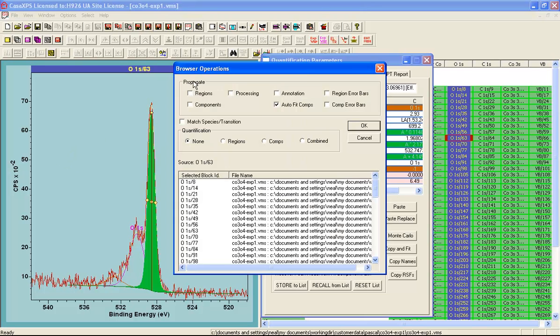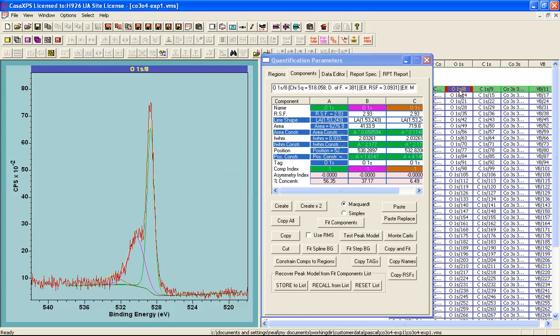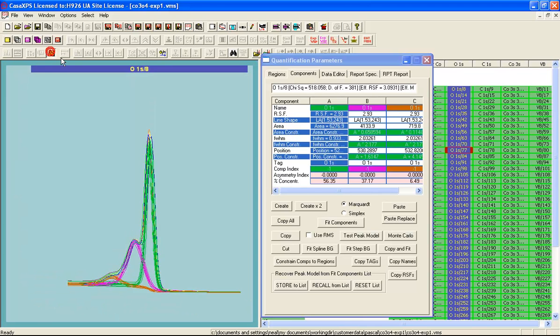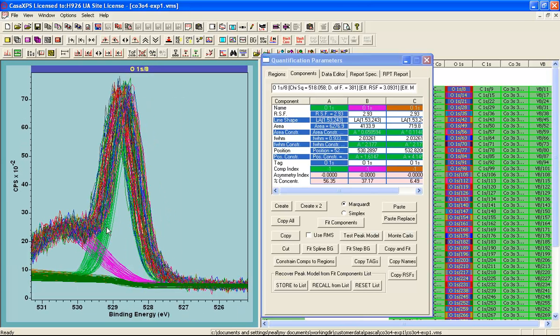So if I propagate, and then examine some of these other spectra once fitted. Indeed, what I'll do is overlay these. And then hopefully we can see we've got a peak model with some kind of description for this primary peak here.